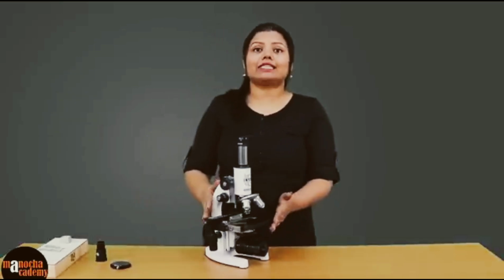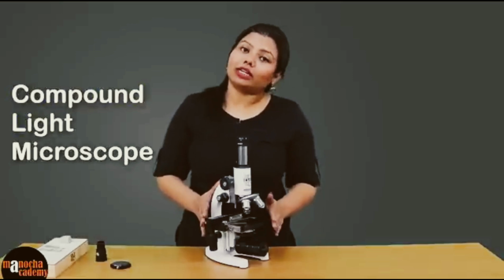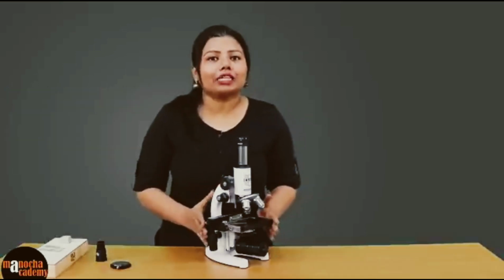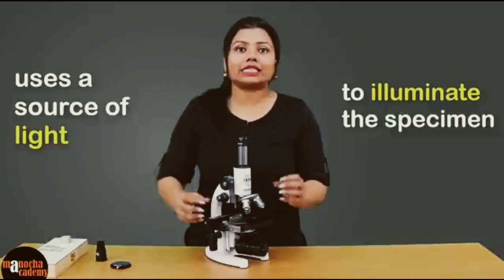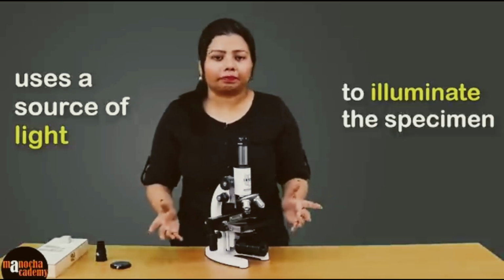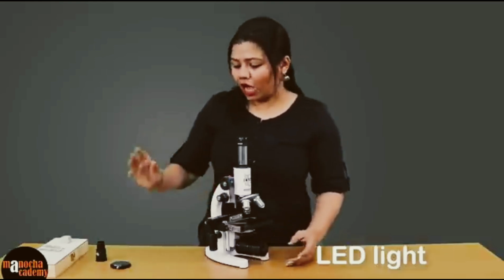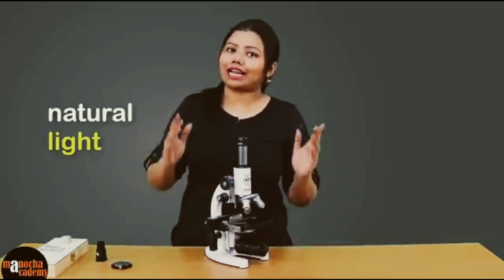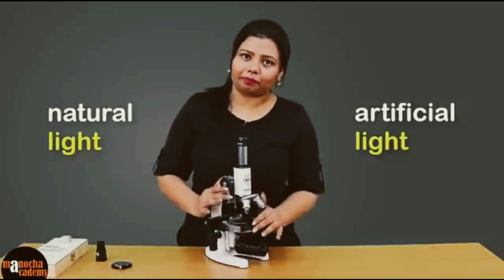Now this is a typical compound light microscope. Why is it called a light microscope? It is called a light microscope because we use a source of light to illuminate the specimen that we are trying to see. So in this microscope, we will use LED light. However, you can also use natural or artificial light to light up or illuminate the specimen.